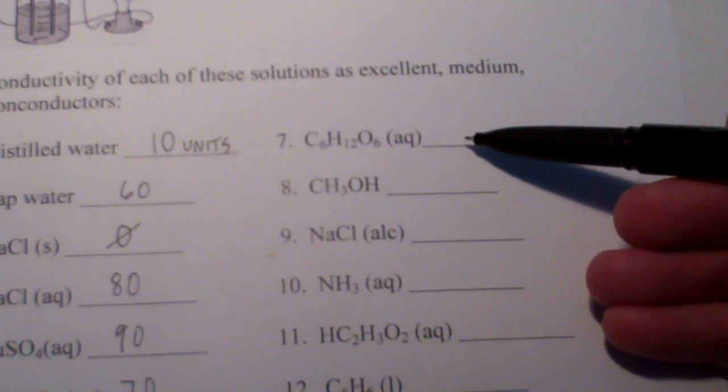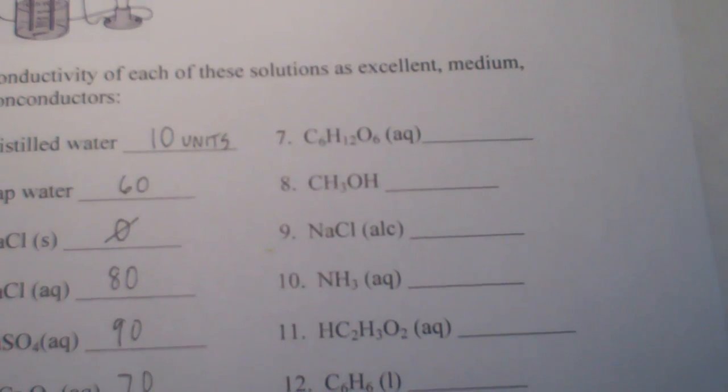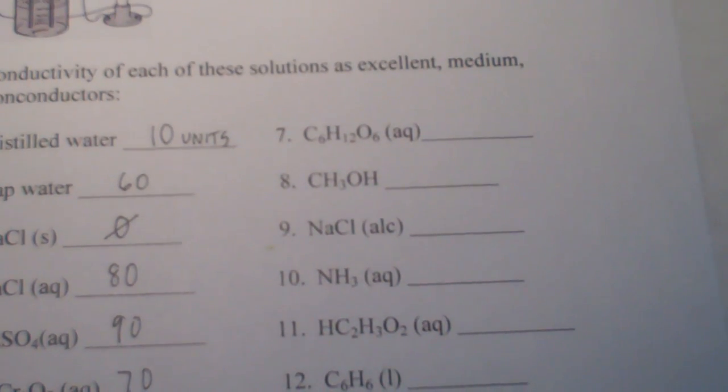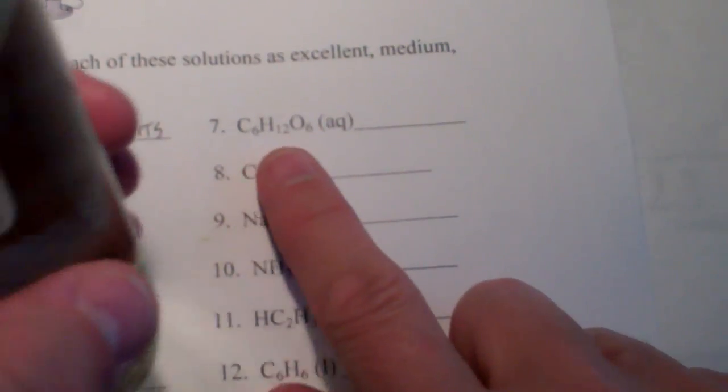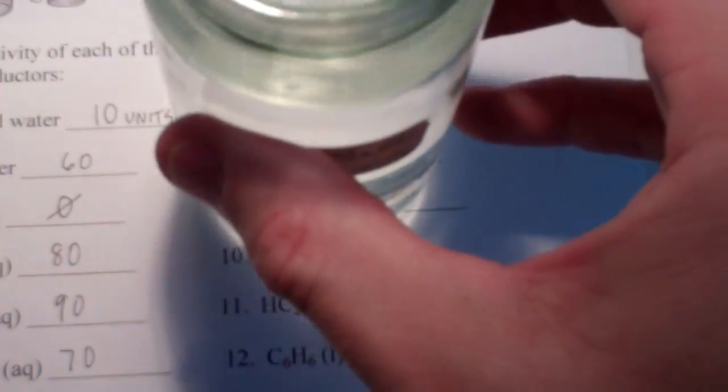Let's try sugar. Is sugar ionic? When sugar dissolves in water, does it dissolve as a molecule? Or does it dissolve as ions? You might want to think about that or look that up. Now, this says glucose and I'll be using sucrose today. We should get the same results no matter what. So, the conductivity meter is in. We'll press our low button. 10. And it says 9.